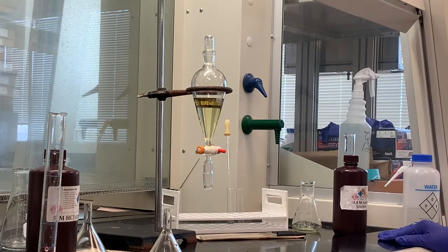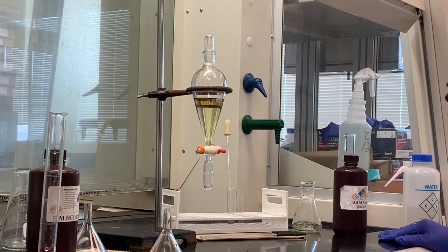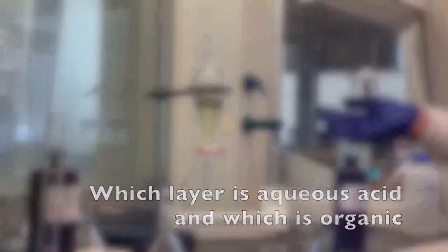So if I take a look at the p-nitroaniline, it does have an amino group that's very similar to ammonia. If you were to react ammonia with HCl, you would form a salt. And that's exactly what happens with this compound. We're reacting the p-nitroaniline, that NH2 group is analogous to the NH3 of ammonia, so it will form a type of ammonium salt. So what we have to figure out now is which layer is what.